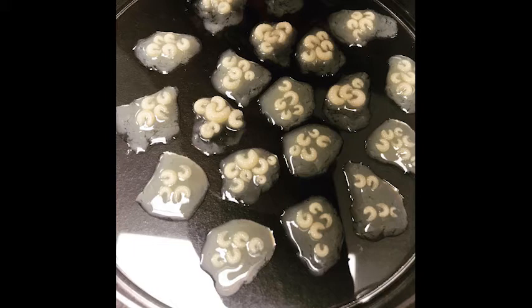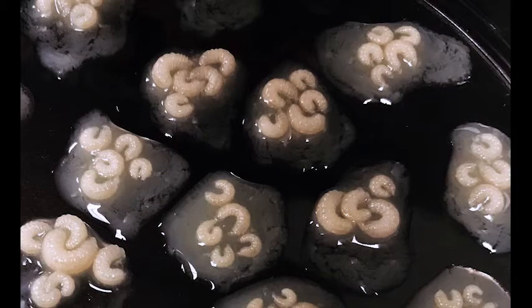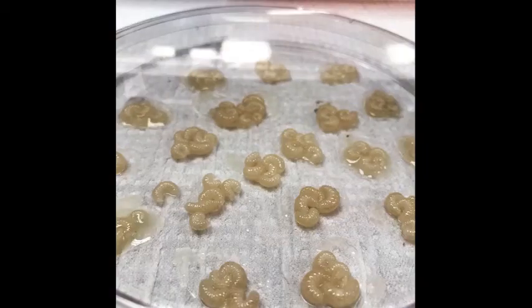And so these bees are ones that are right about to pupate. They're really big. They're about to go into that pre-pupal stage where they'll start to look less and less like a grub and more like a bee. And here, after we can see what those will look like, these are bees who have reached what we call the pink eye stage, unsurprisingly, noted by their pink eyes. Before this, their eyes are white. You can see it looks like a bee. The shape of a bee is there, but they're totally white.